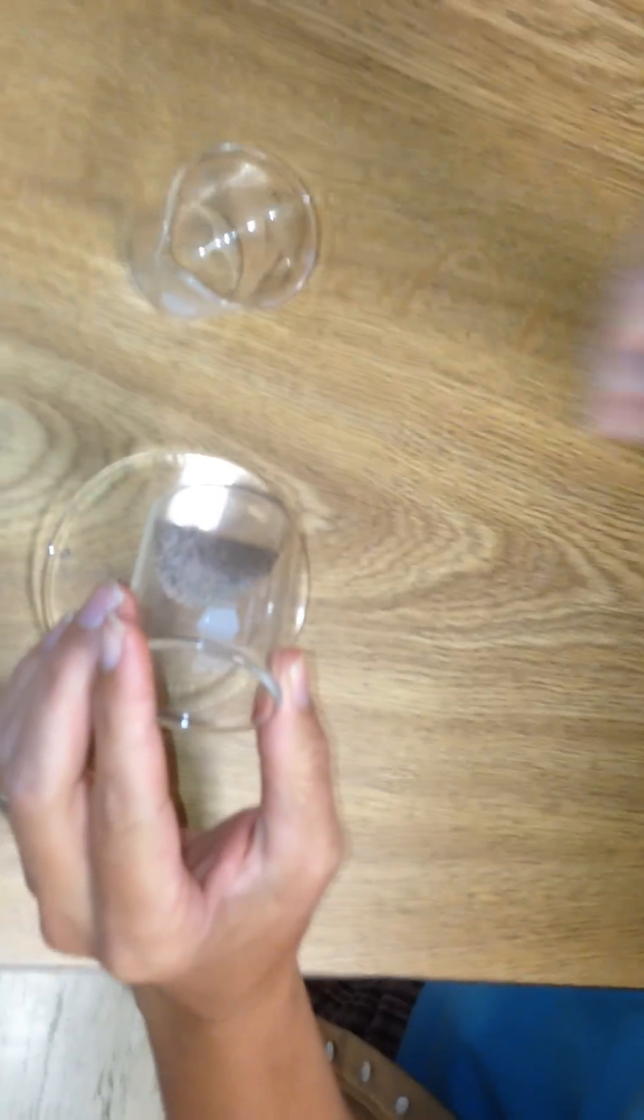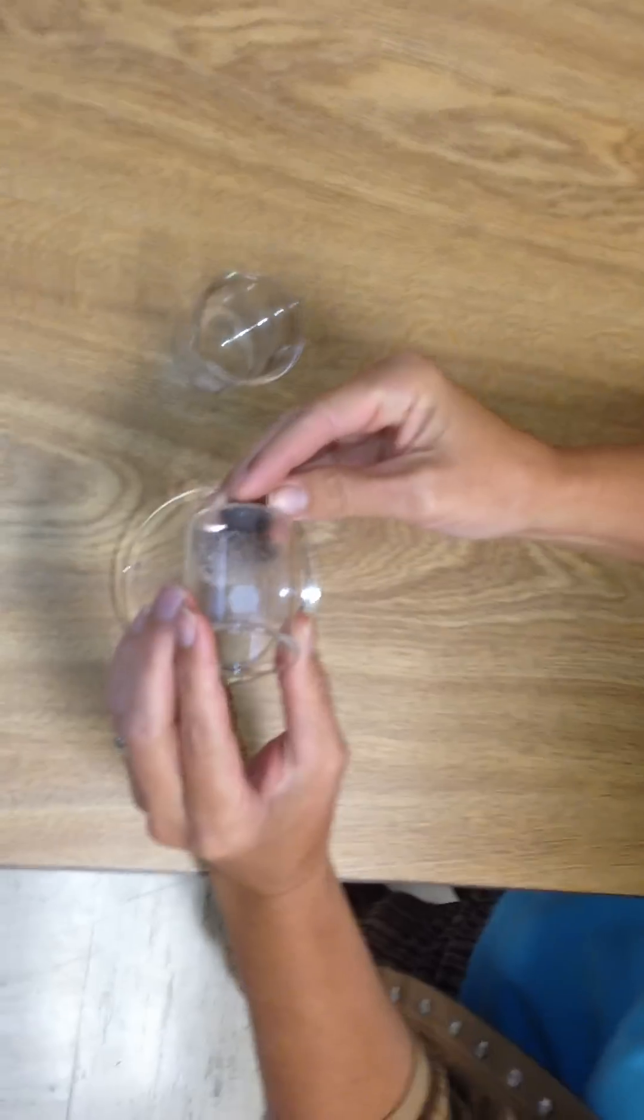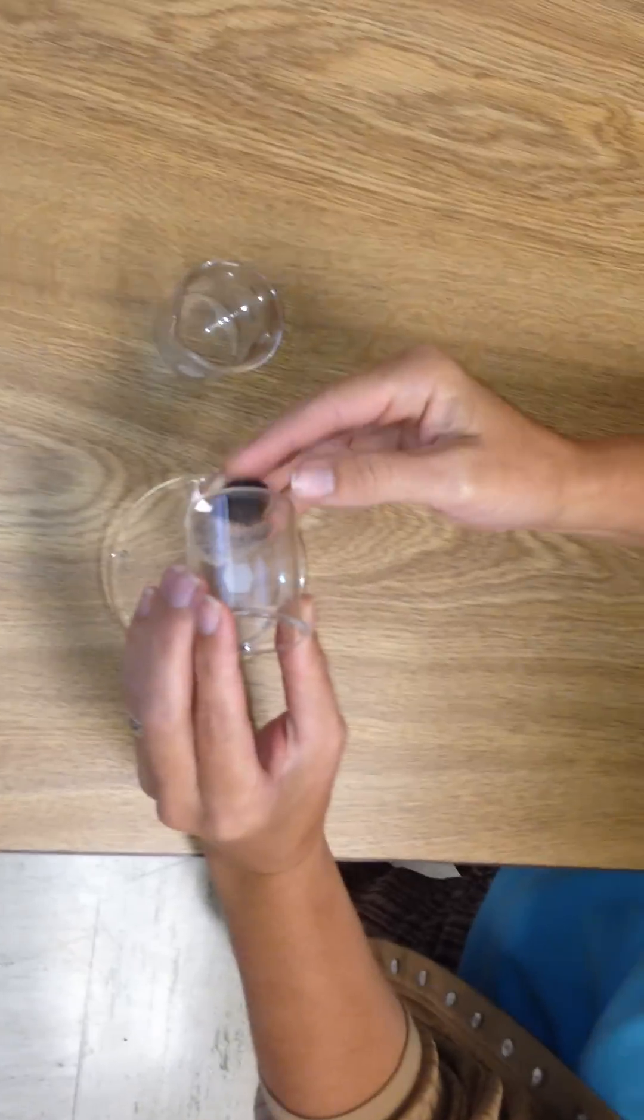Well, in our lab what we will be doing is placing a magnet on the bottom of a beaker and pulling some of the iron filings up, tapping it a little so that we can drop some of the sand. When you said sand filings I think you meant iron filings. Sorry, and the sand will be dropping down.